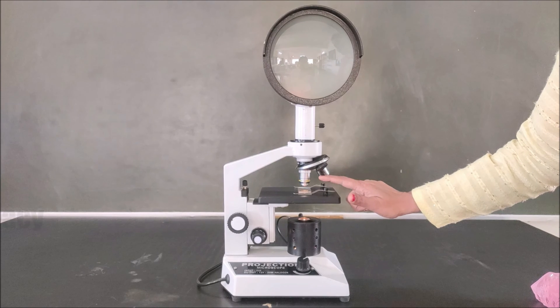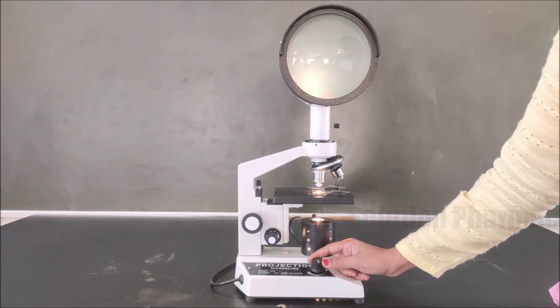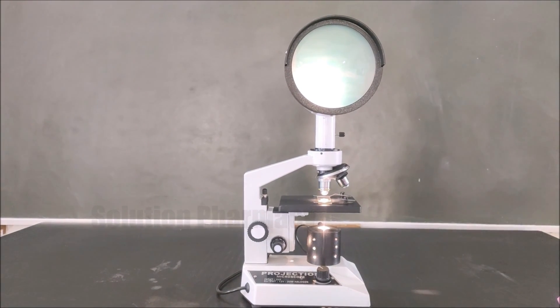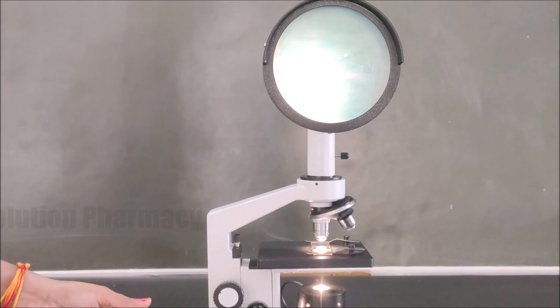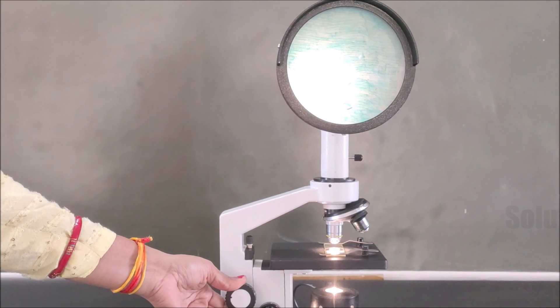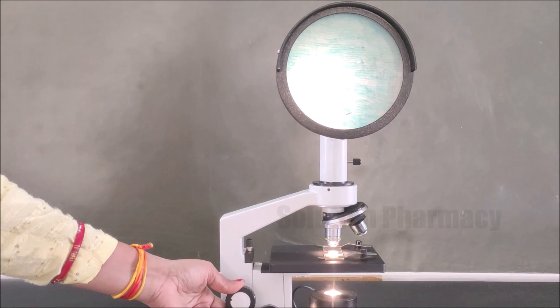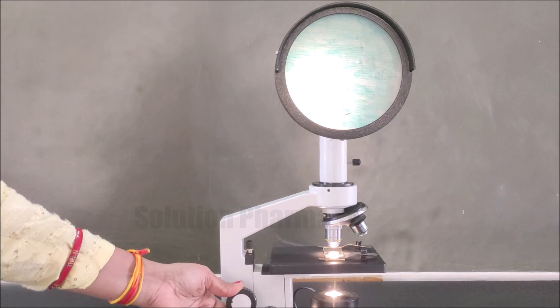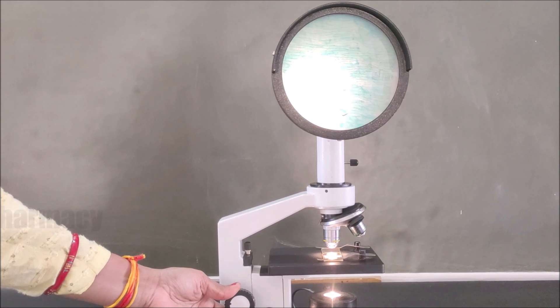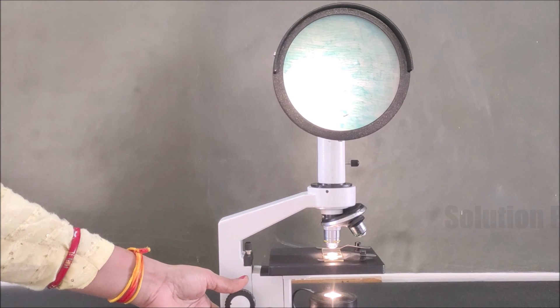After properly placing the slide on the stage, secure it with the stage clips. Then with the light adjusting knob, adjust the light focused on the stage. Here rotating the knob clockwise increases the intensity of light on the screen. After adjusting the desired amount of light, use the coarse adjustment knob to focus the specimen — rotate it so the objective lens properly focuses the onion cell slide and the magnified image projects on the screen.